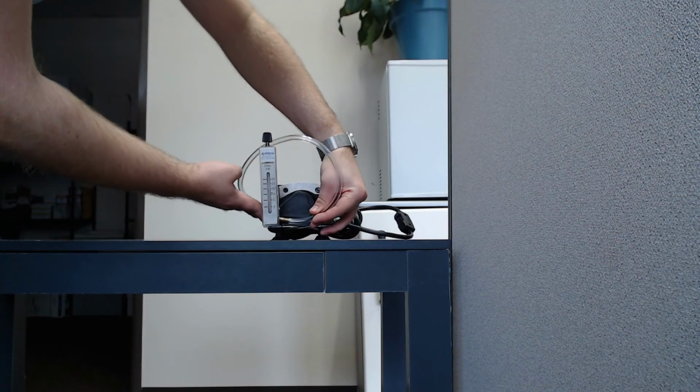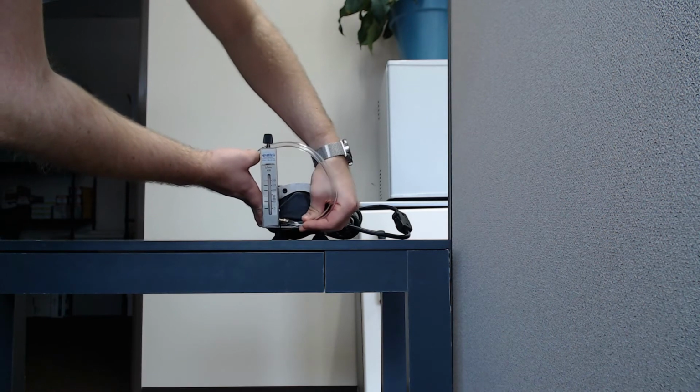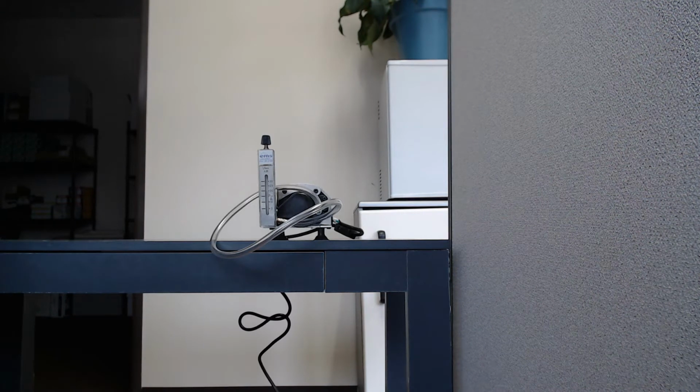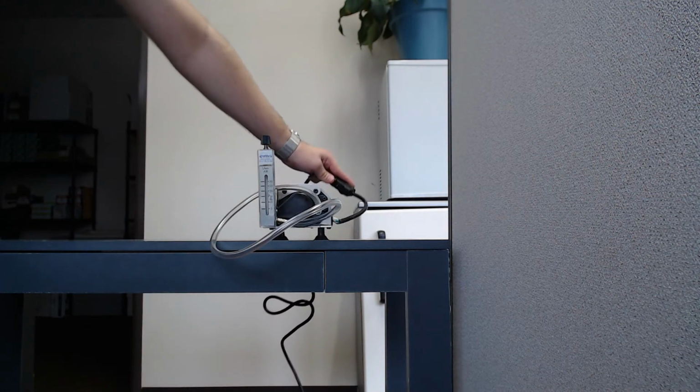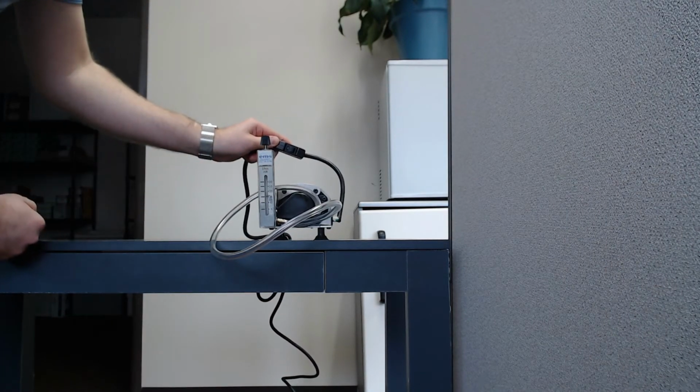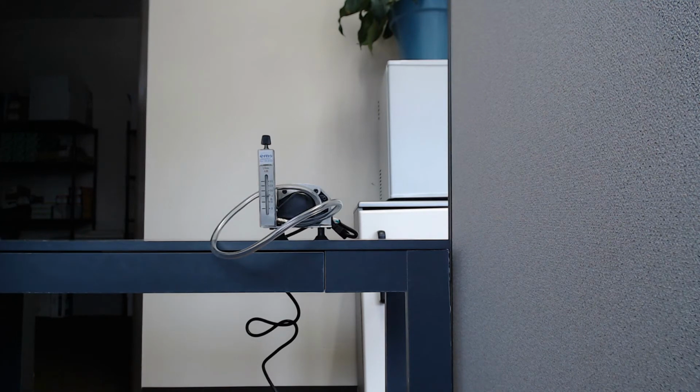Step 1. Attach plastic tubing to your pump nozzle. The other end of this tubing will attach to your cassette. Step 2. Turn on your pump and allow it to run for 1 to 5 minutes without a cassette attached, so the flow rate can stabilize. You'll be able to tell that the flow rate has stabilized because the sound of the pump will be consistent and the rotometer will be steady.